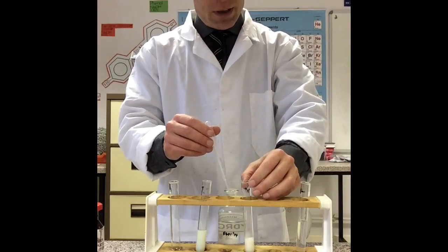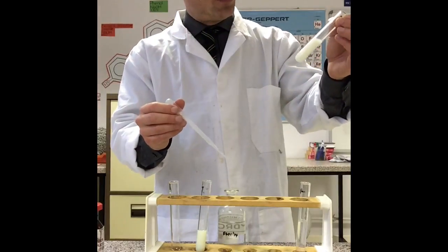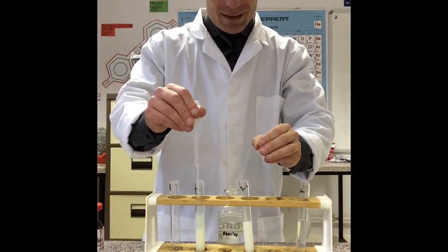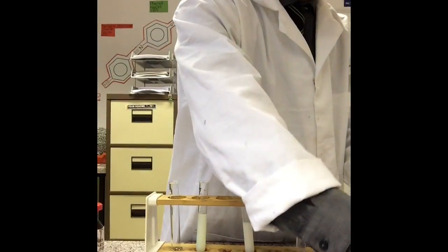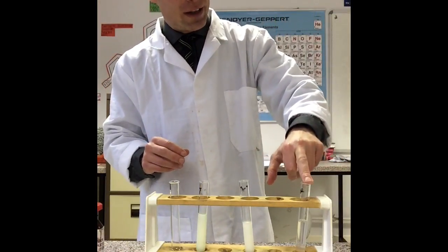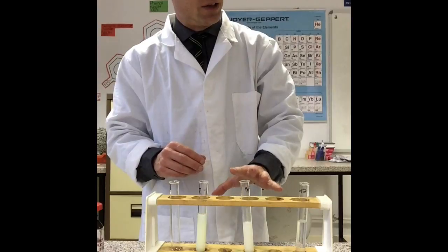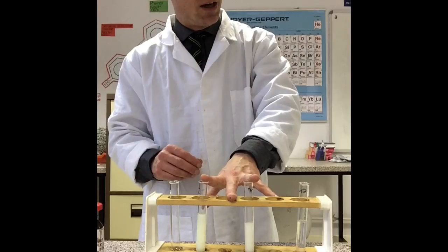What about bromide? Silver bromide — has that dissolved? No, it hasn't dissolved. And nor does the silver iodide. Neither of those dissolve in dilute ammonia solution. So we can say the silver chloride dissolves in dilute ammonia, but the silver bromide and iodide do not dissolve in dilute ammonia. With these, we're now going to test with concentrated ammonia solution.